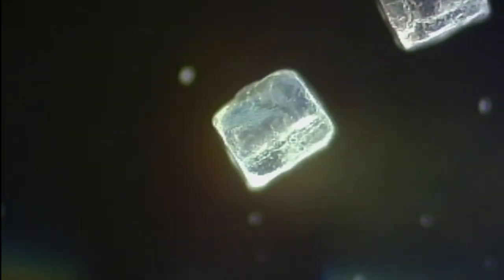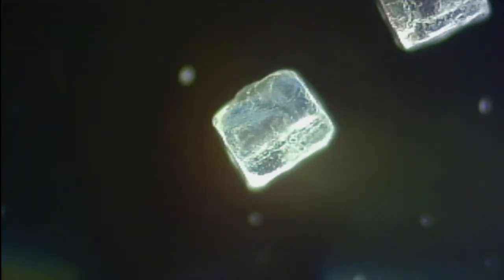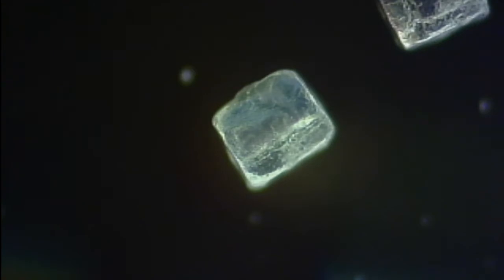See, the background is very bright. In order to get visual on the salt crystals, you have to way overblow it, and I get an enormous hot spot in the center from the illuminator on the lowest power. I've still got some speckles in there. They're real hard to get rid of on the sensor. Anyway, so IR filter back in place, which helps the colors look a whole lot better, and my dark field stop, which is great.